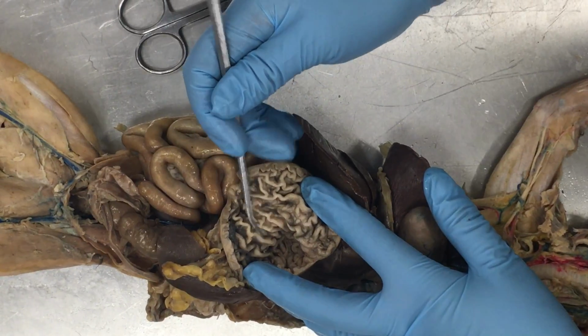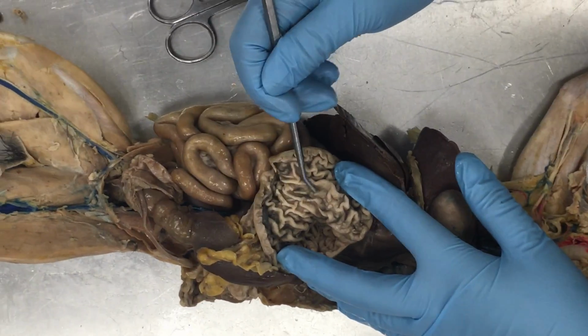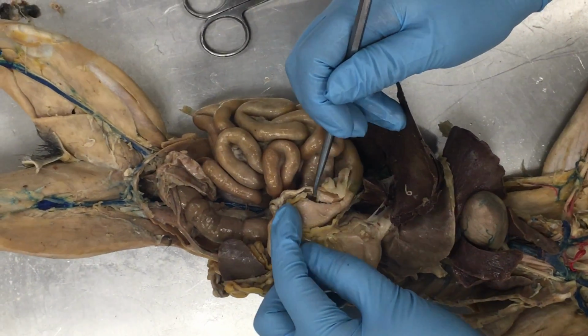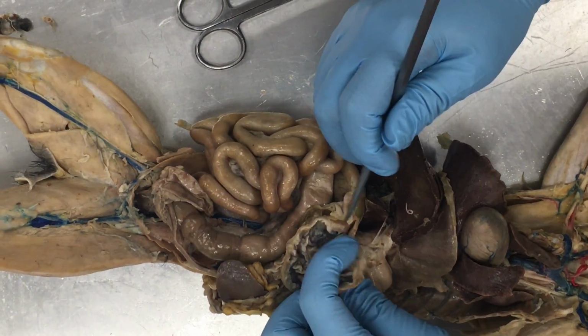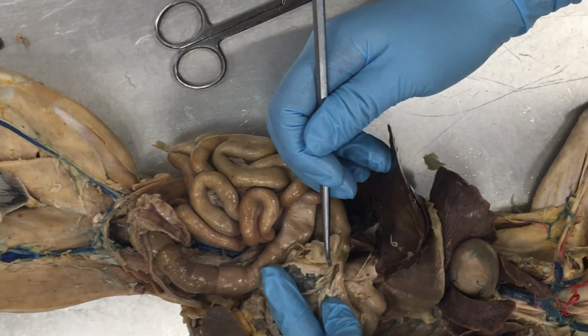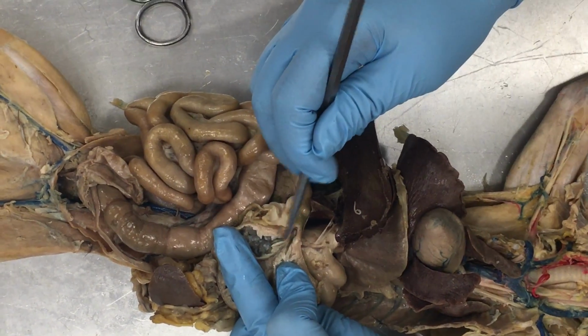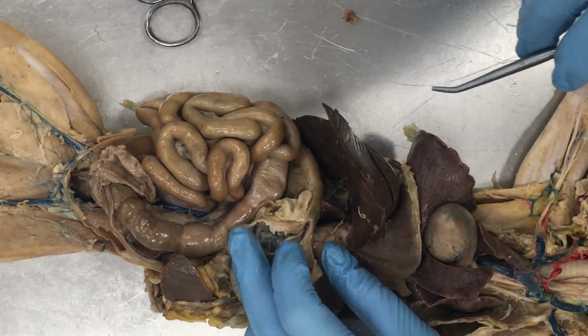Open it up on the inside. We have lots and lots of these bumps. These sort of really deep, thick folds in the stomach are called the rugae. And then ultimately, we're going to pass out of the stomach into the small intestine through one more sphincter. I've cut it open. You can see this thicker muscular wall right here. This is the sphincter right at the pyloric portion. We call that the pyloric sphincter.